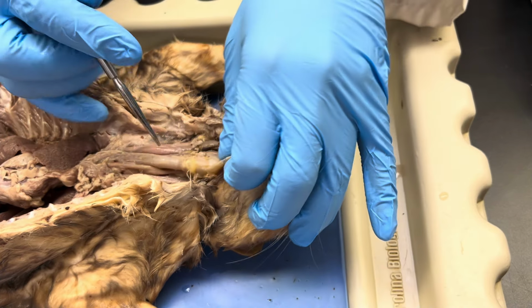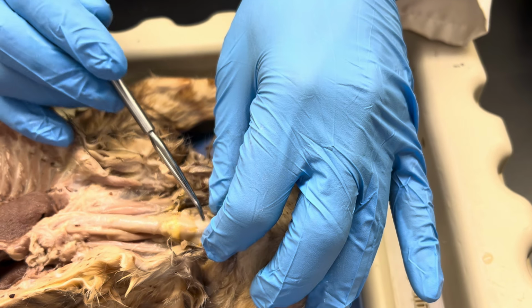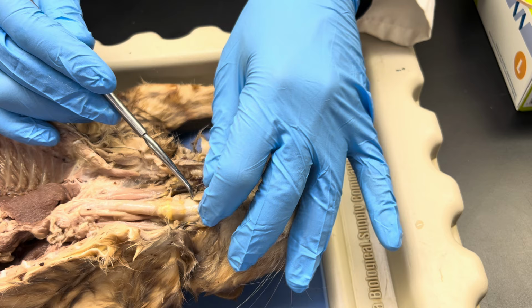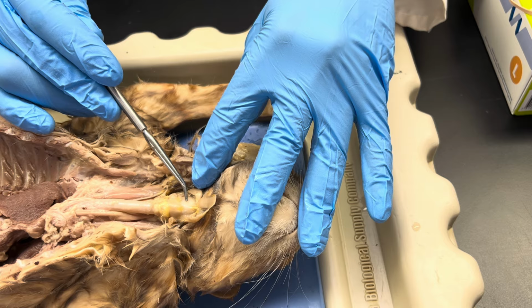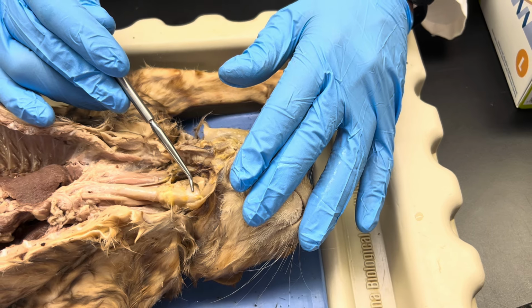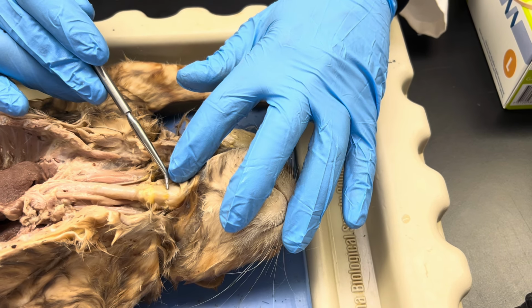But you see this? It looks white, and I'll try to tap it so you can hear. Well, you can't really hear. But if you had gloves on, if you want to get some and feel this, you can. But you would be able to feel this is a little firm. It's not bendable like this trachea, but this cartilage-based box right here, that is the larynx. It's what houses the vocal cords. All right, so the larynx is here. It's at that superior margin of the trachea.